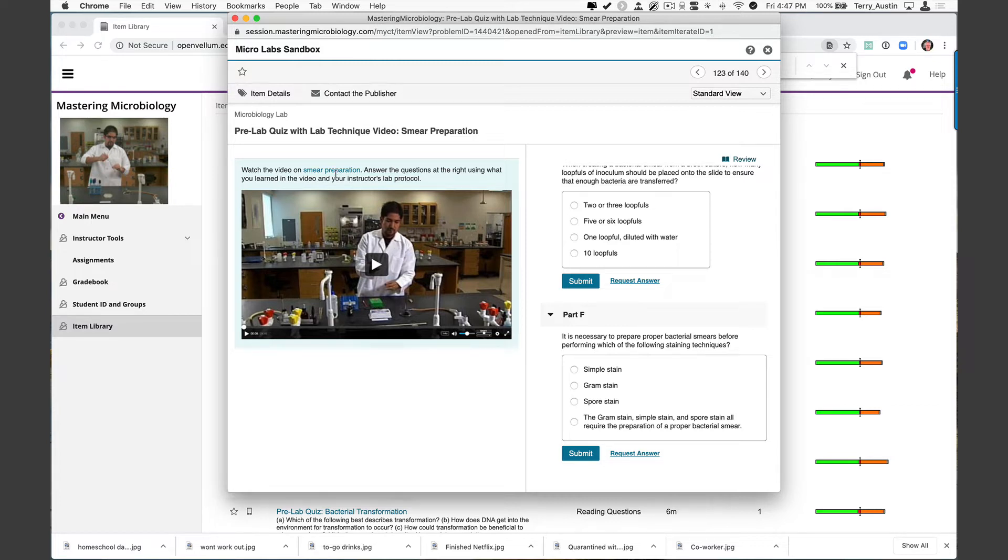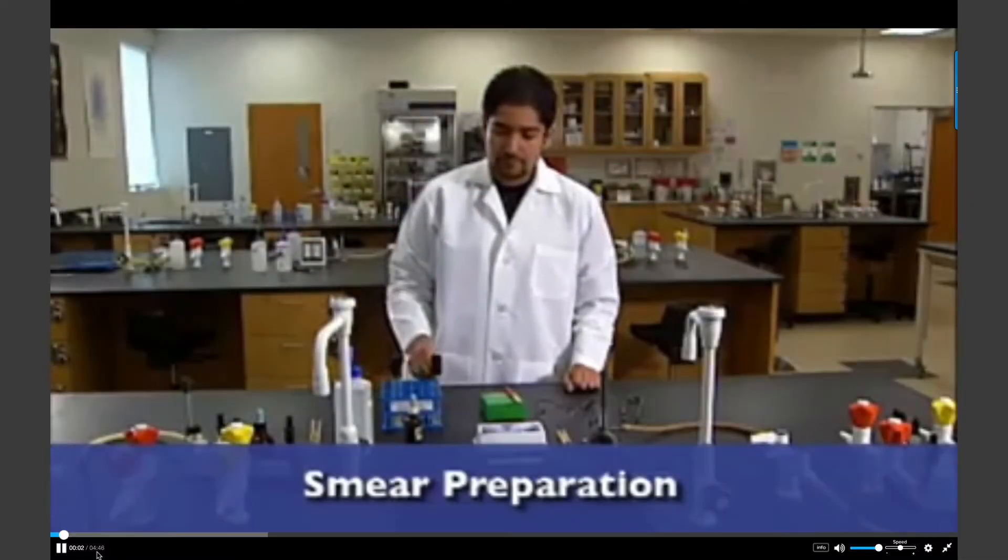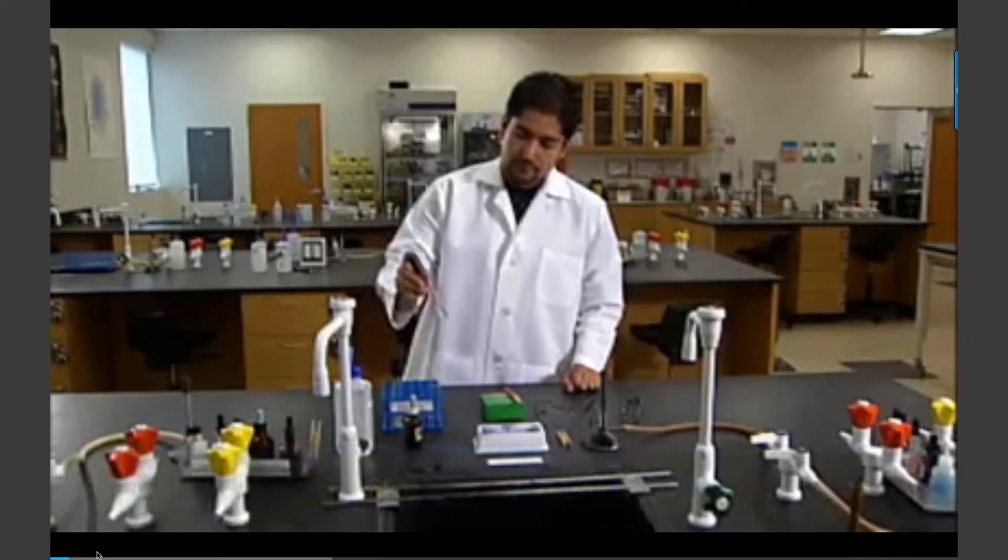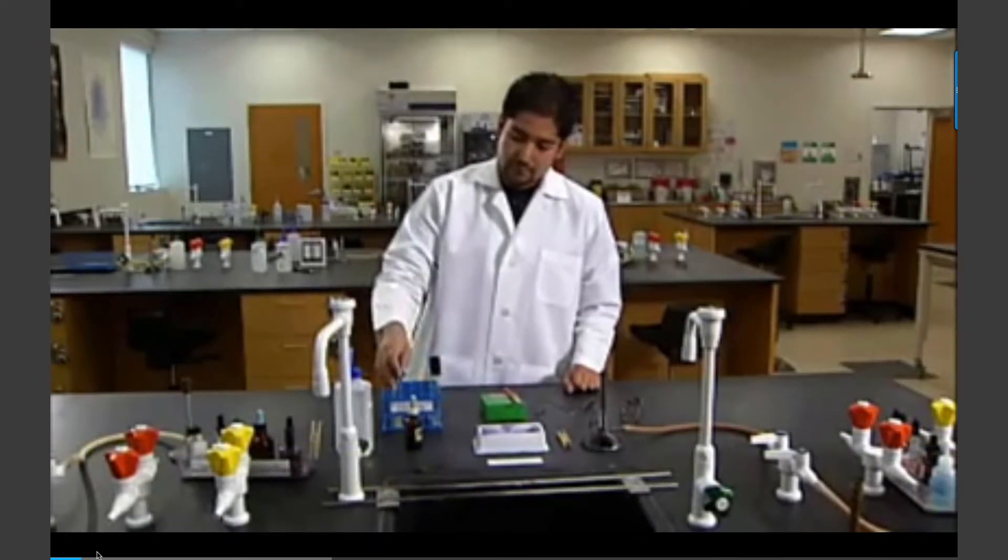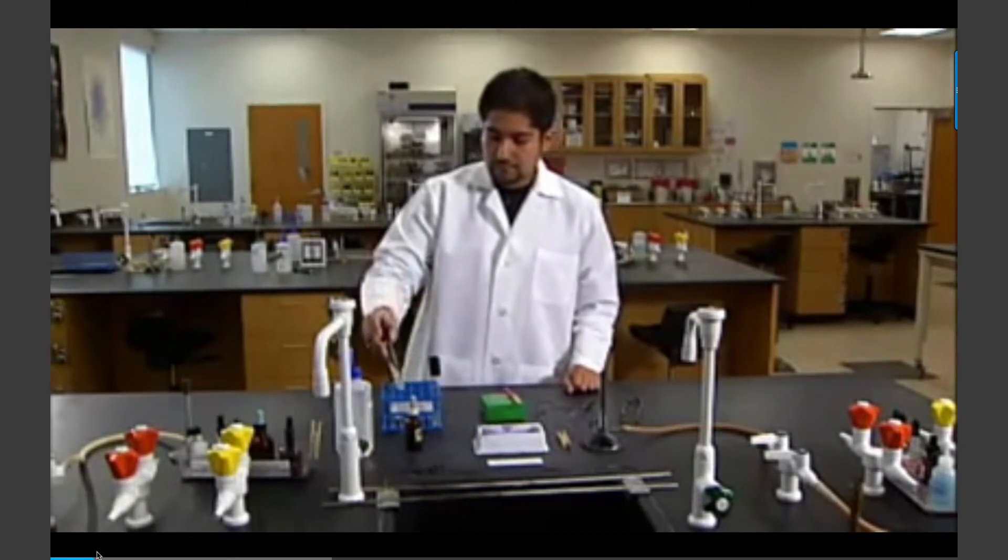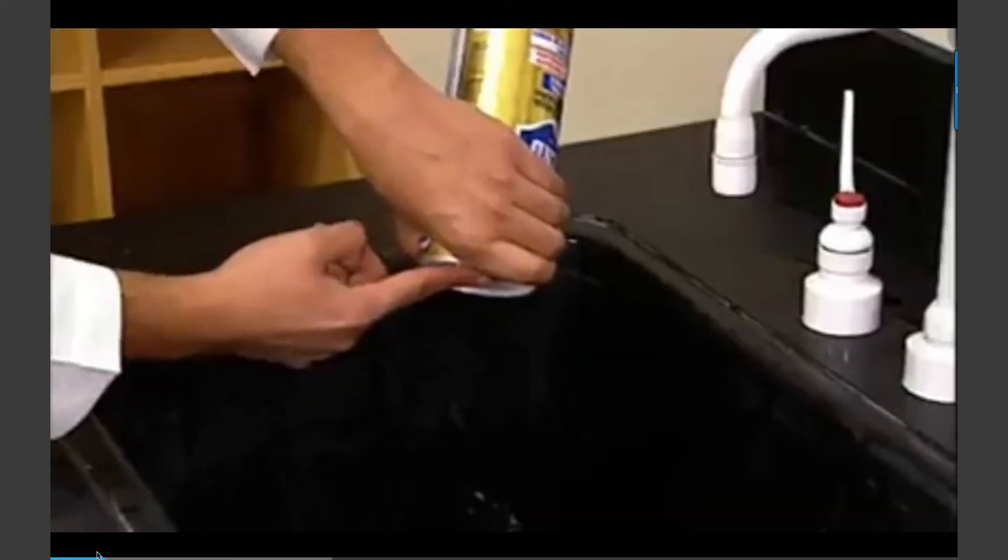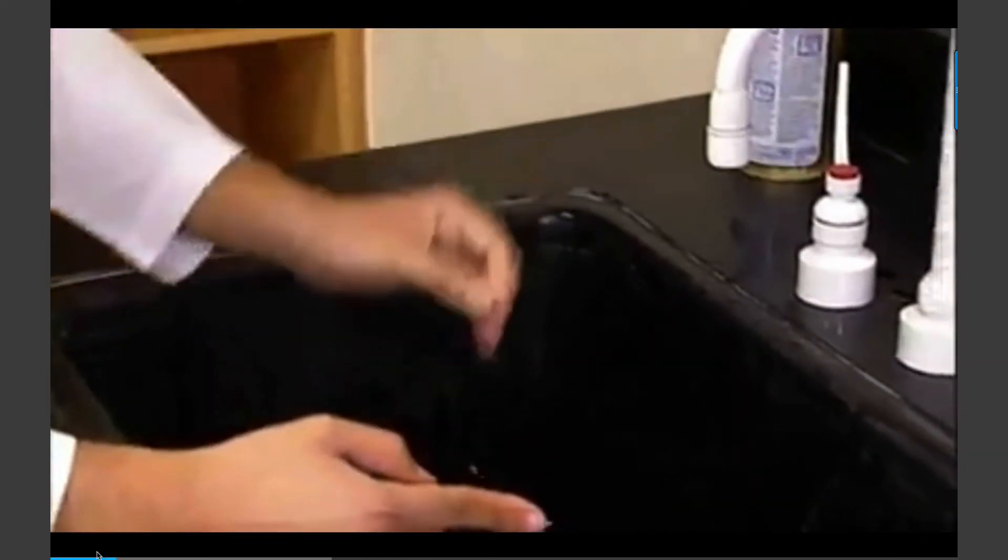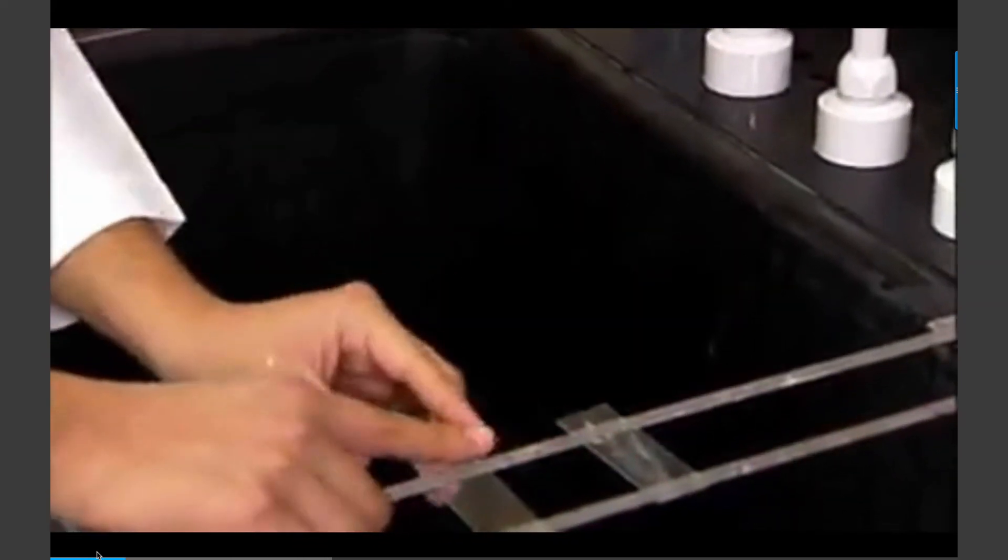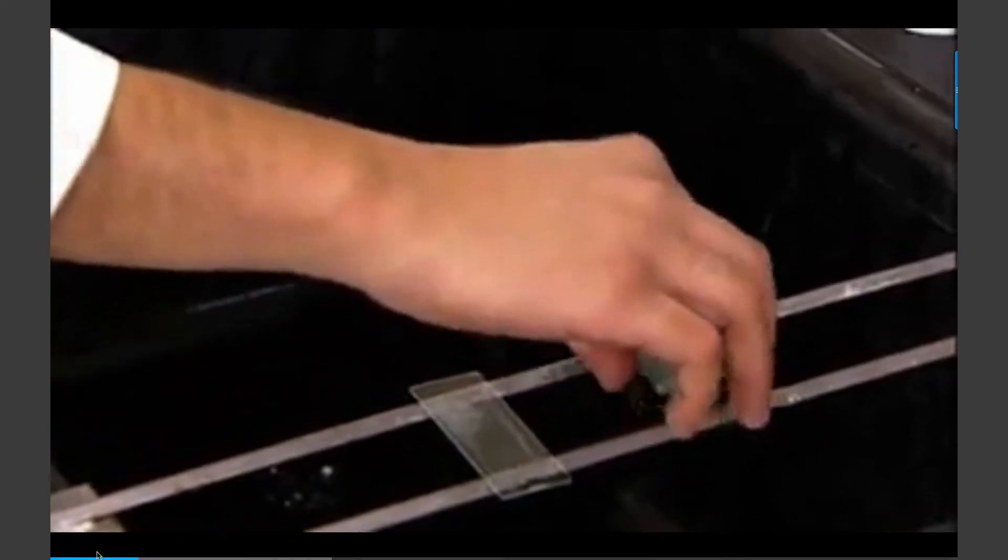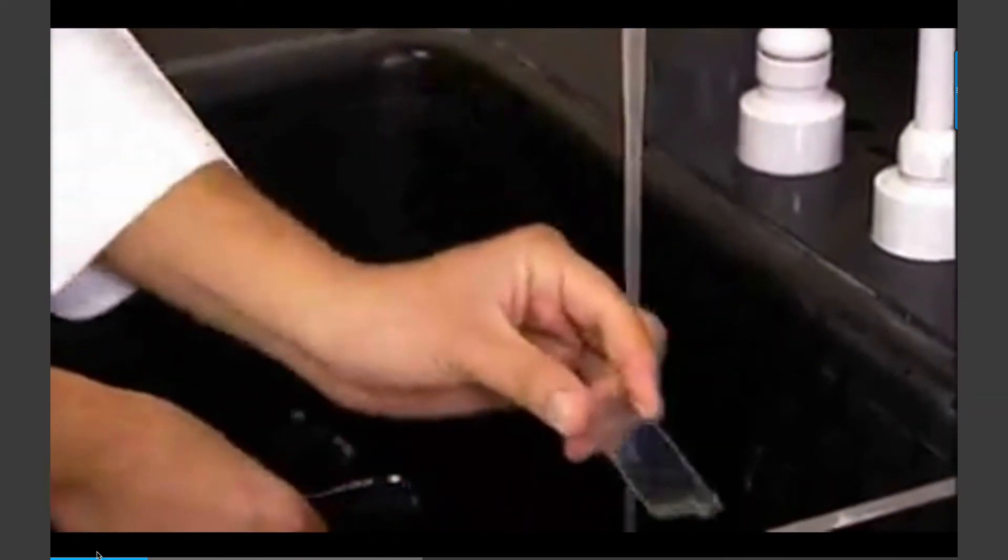Let's open the video. Prior to staining bacteria for viewing under the microscope, a bacterial smear must be made. To make a microscope stain of bacteria, the bacteria must be placed on the slide in a thin smear. Smears are prepared differently for solid and liquid cultures. Begin by cleaning each slide. Put some cleanser on your finger and then spread the cleanser across the slides. Rinse the slides with water to remove the cleanser and blot the slides dry.